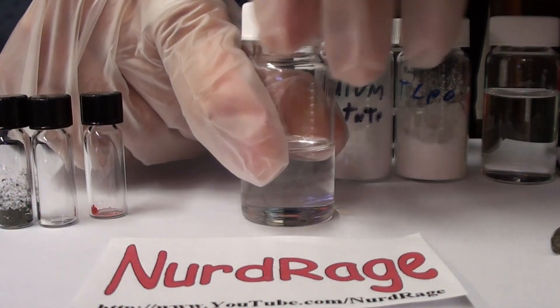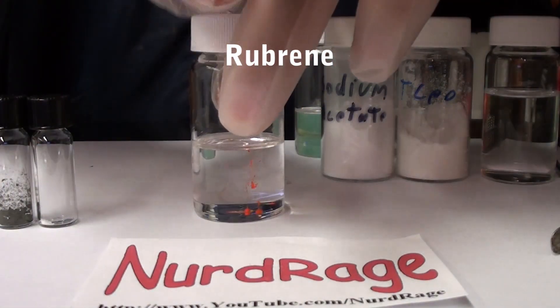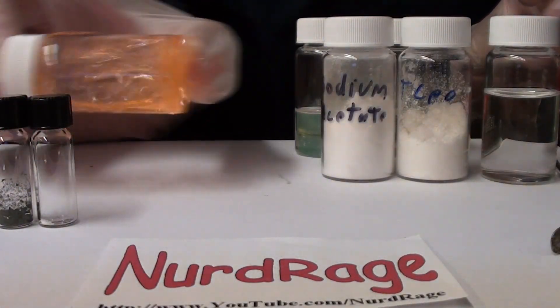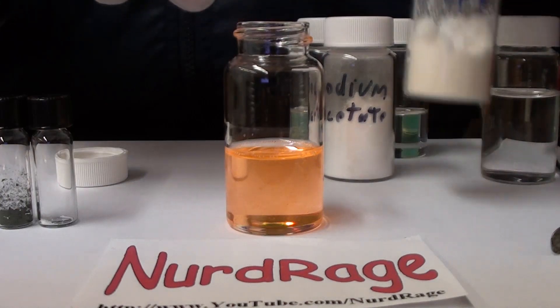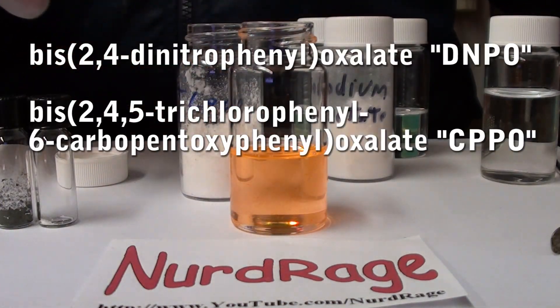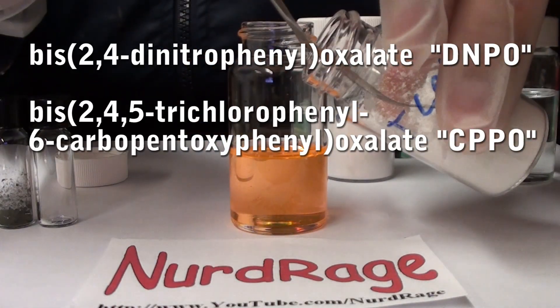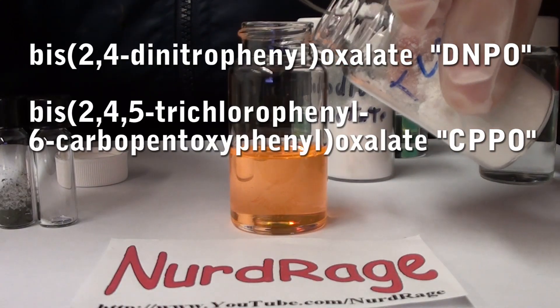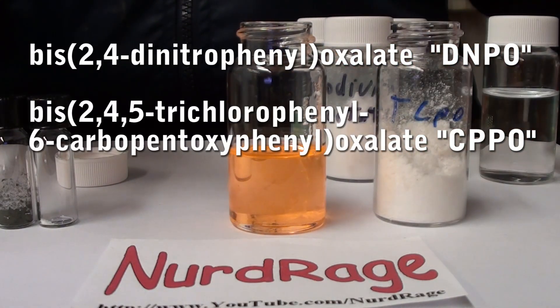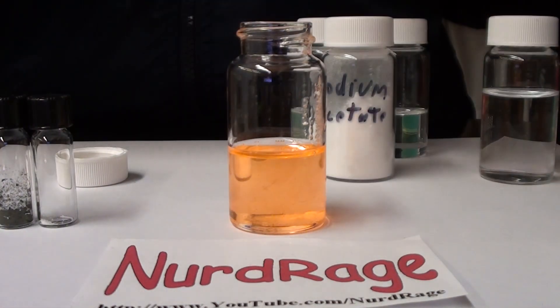Let's start with a new batch of diethyl phthalate. Our next dye is rubrene. It looks bright red in a solid state, but after mixing it gives a bright orange color and will give a bright yellow glow. We add in our TCPO. Other chemicals that can be used include bis(2,4-dinitrophenyl) oxalate, also known as DNPO, and bis(2,4,5-trichlorophenyl-6-carbopentoxyphenyl) oxalate, also known as CPPO. A lot of peroxalates can be used, but the ones mentioned are the most useful.